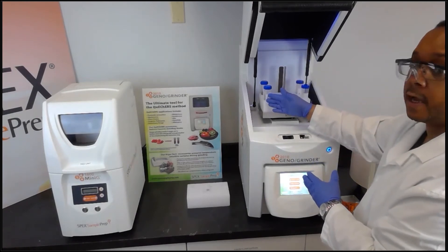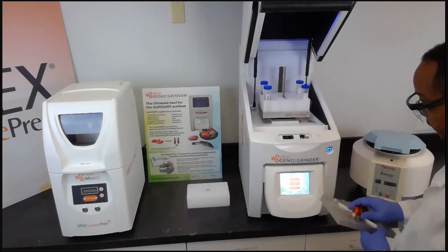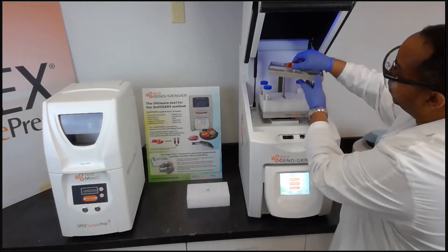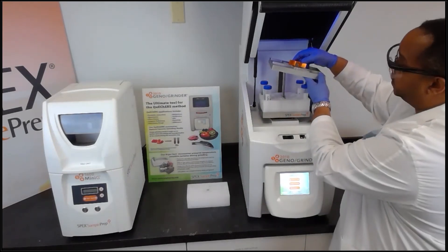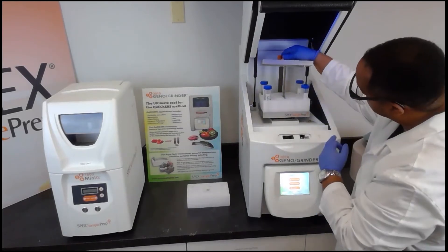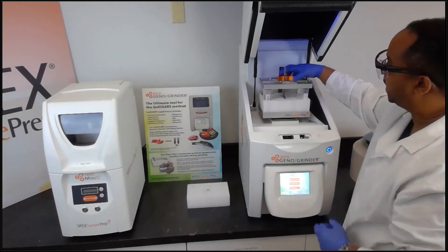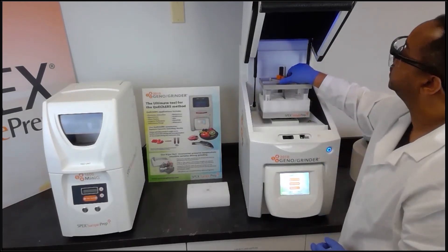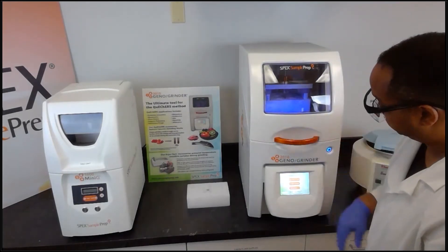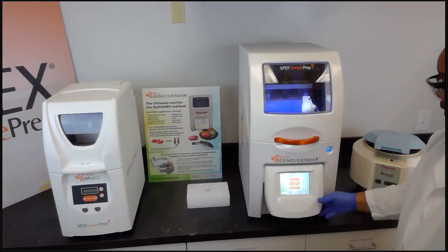We can use an empty tube as a placeholder if needed. Basically, you want to balance the left side with the right side. In order to keep the threaded rod from being damaged, we hold and depress the quick release button, slide the clamp lid onto the rod down to the top, give it a few turns to secure, then close the lid.